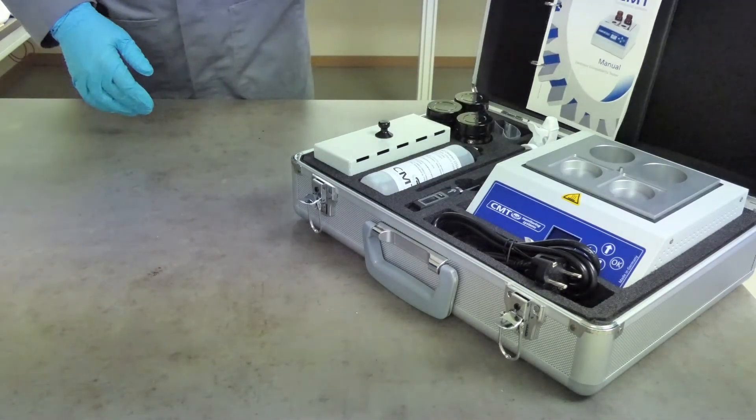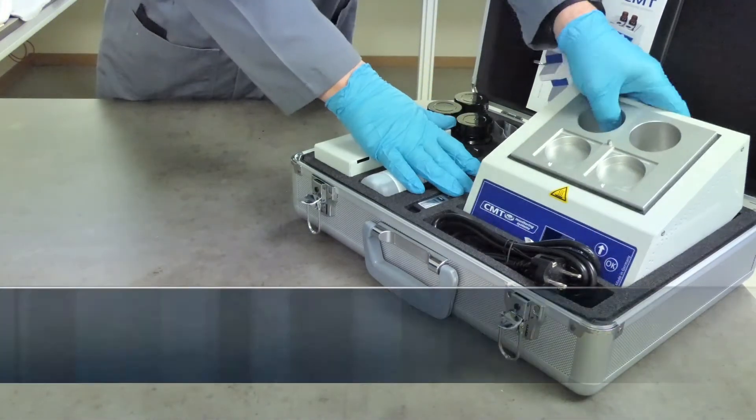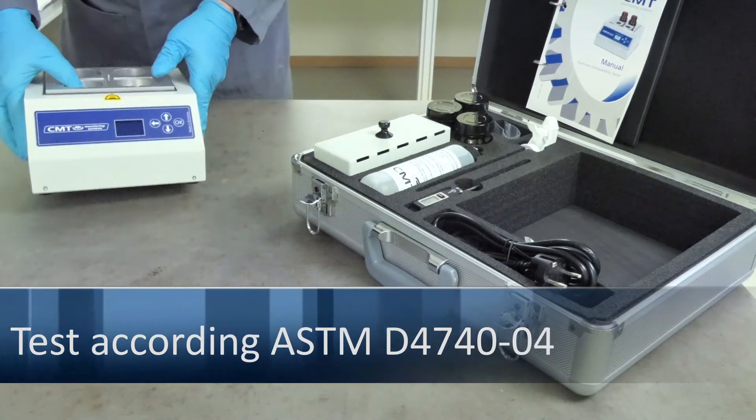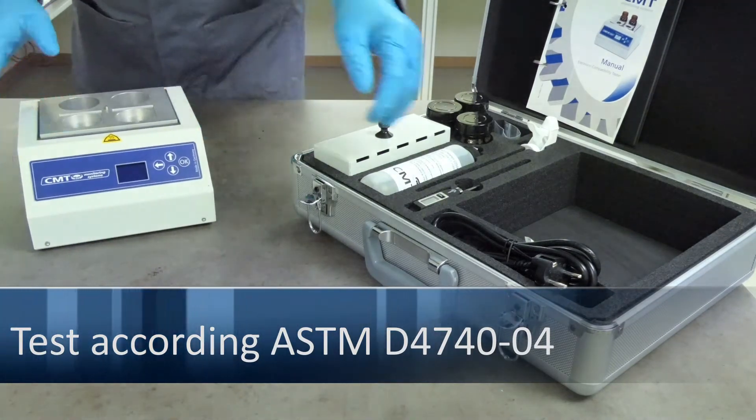CMT's electronic compatibility and stability tester is according to ASTM D4740.